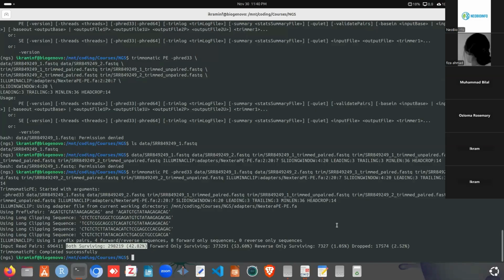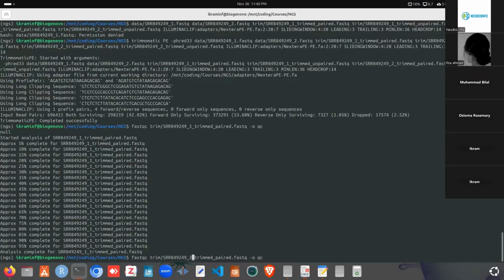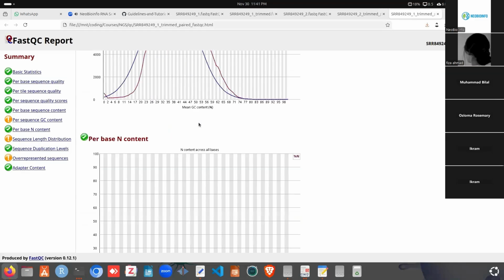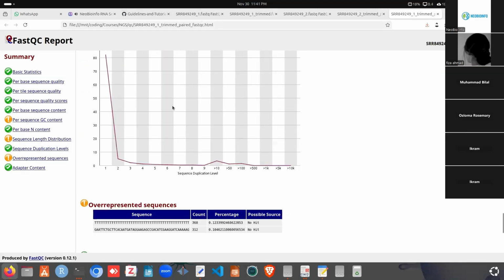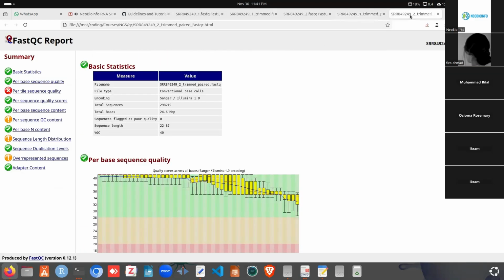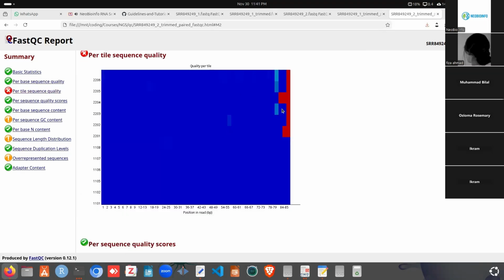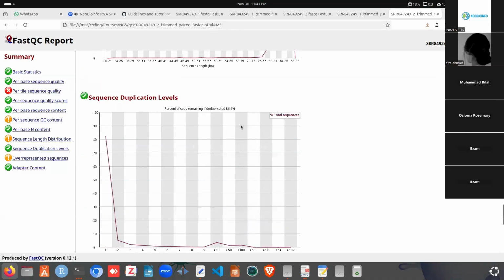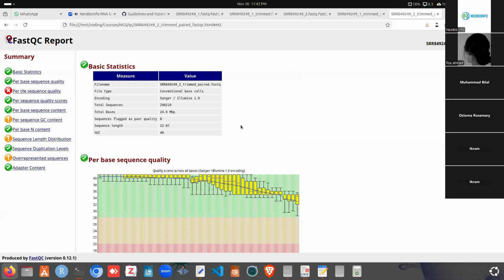We can check the quality. For that, we need to run FastQC. For that, we can specify the QC directory for the paired files. So here we can see this file and this file were generated. We can see read one has actually no issue after trimming. This is the read one file, and this is the read two file. After trimming, it has an issue with the tile sequence quality. That is actually fine, and it removed the adapter content completely. So our trimming has been successfully done, and we can proceed to the next analysis.